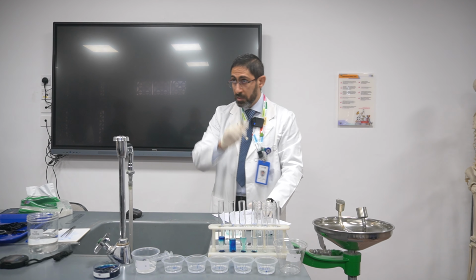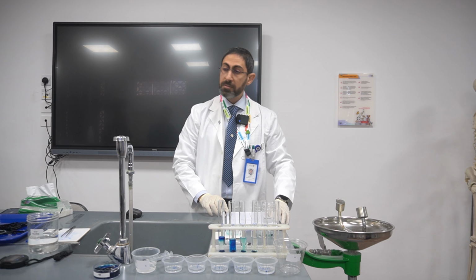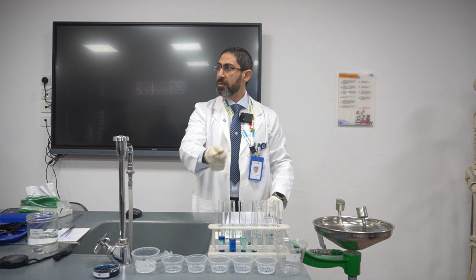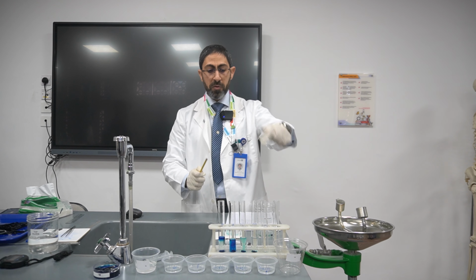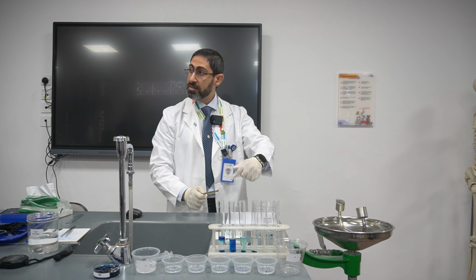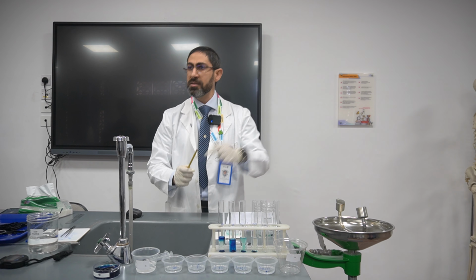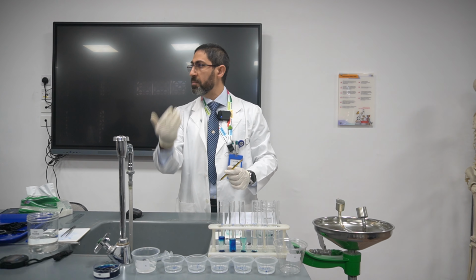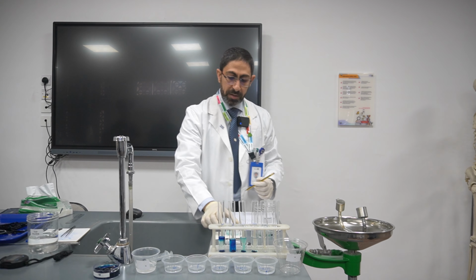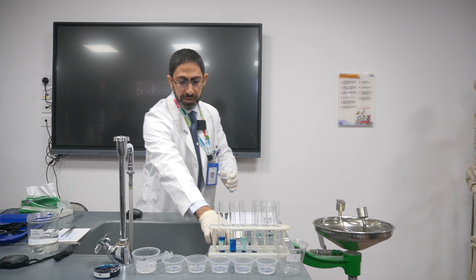Anyone knows why? The water potential is lower in comparison to the distilled water. So there will be a net movement of water from the solution to inside the plant, but in comparison to the previous one, it is less. So the amount of water inside is less. So the color intensity inside the plant will be higher, will be more. Yes, then I will discard it. Same procedure.